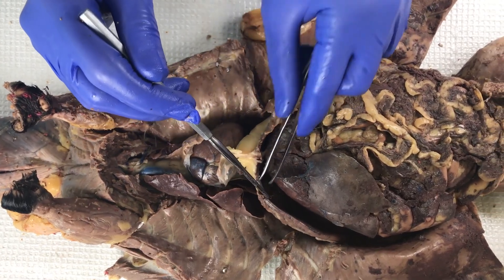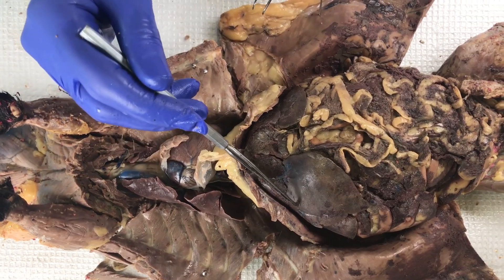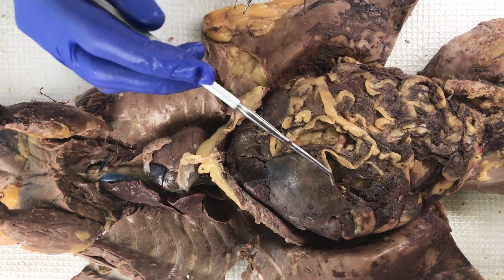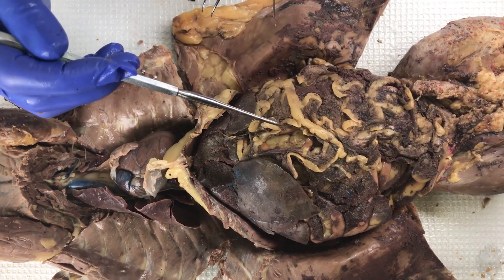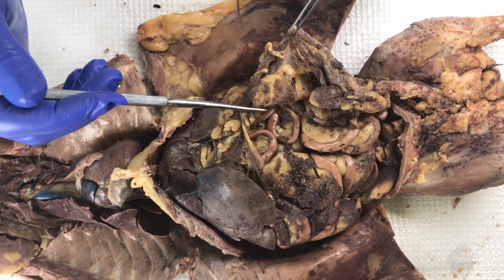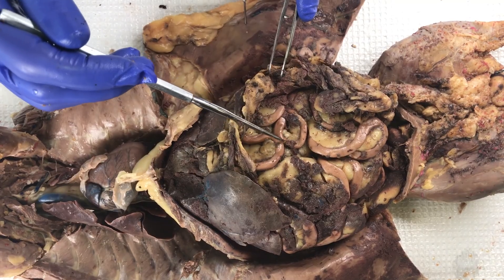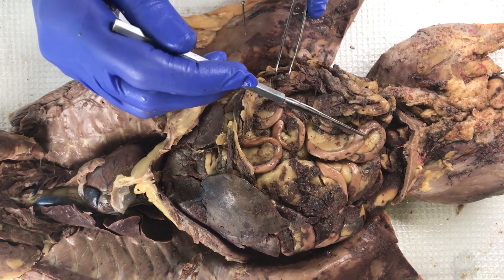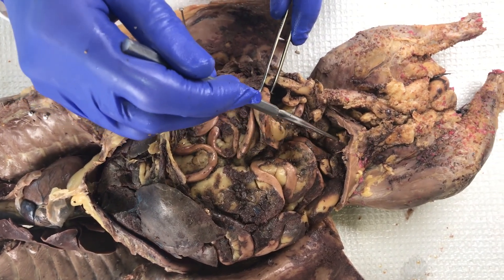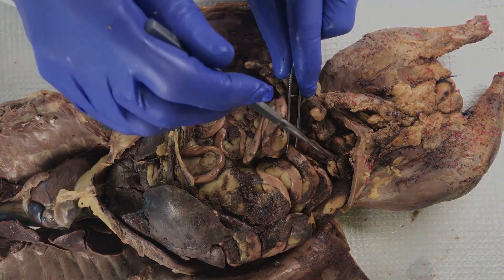We have the diaphragm, which separates the thoracic and abdominal cavities. We have the lobes of the liver. In this specimen, the greater omentum is quite extensive — you must move it out of the way to reveal the small intestines underneath. Moving those, you can see the urinary bladder right here, and the large intestine and the colon right here.